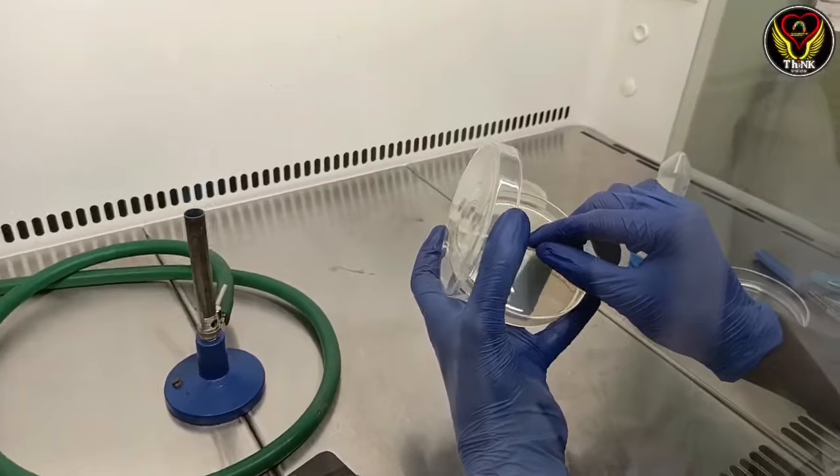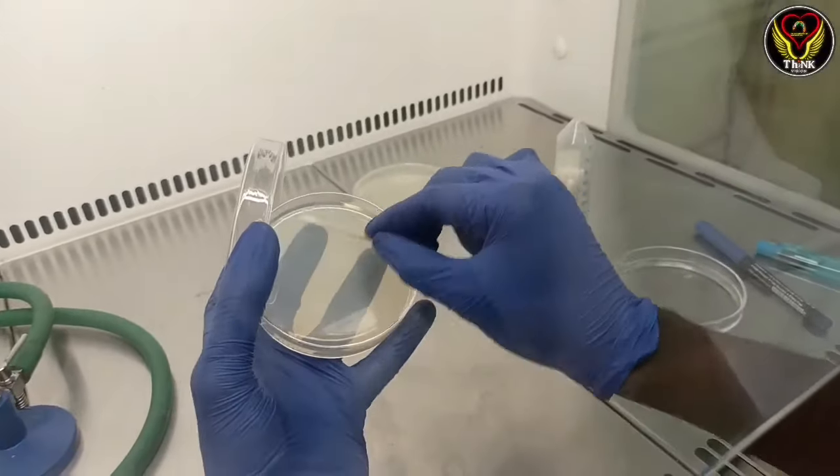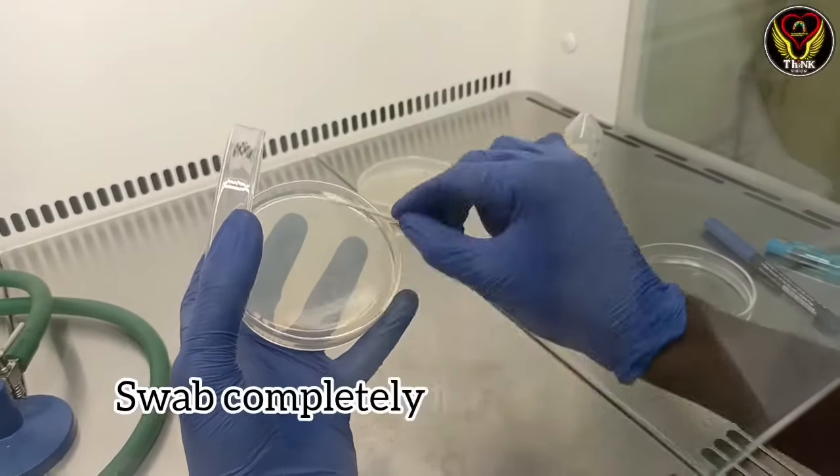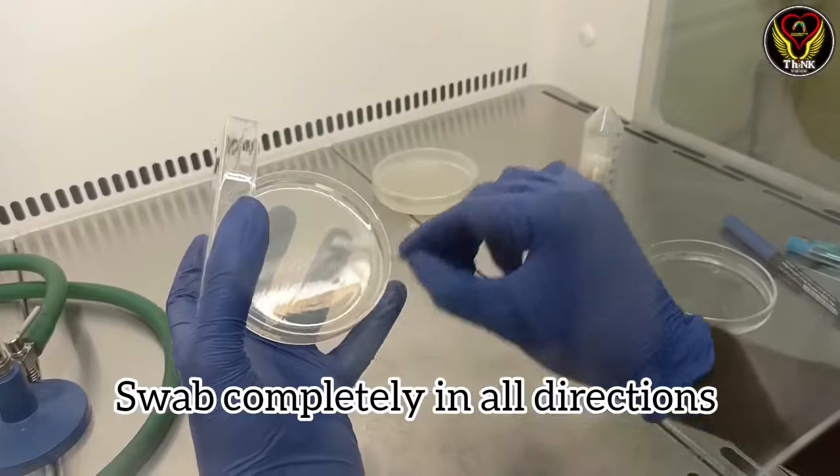Open the plate. Swab the full plate so we can cover the maximum plate area.